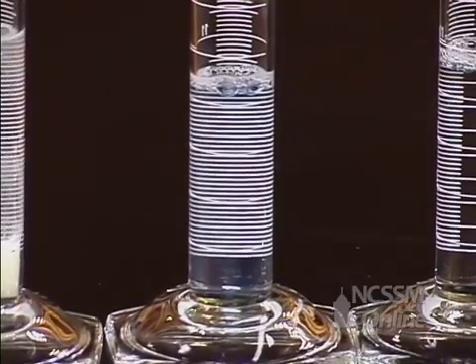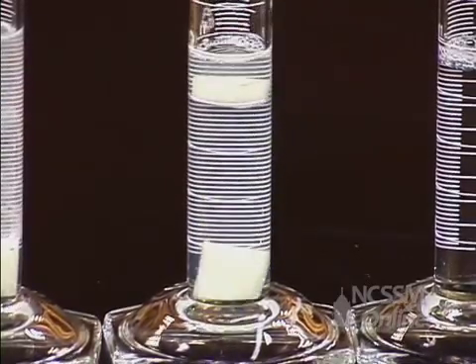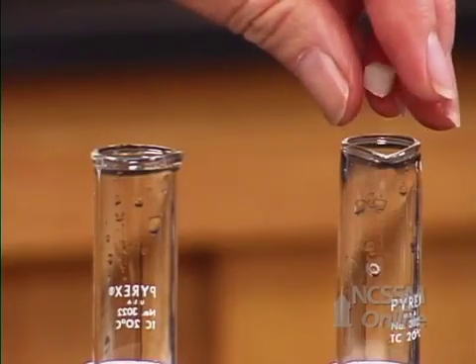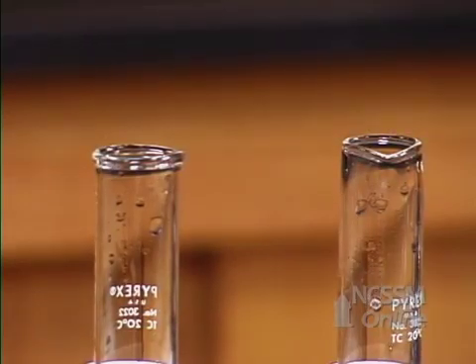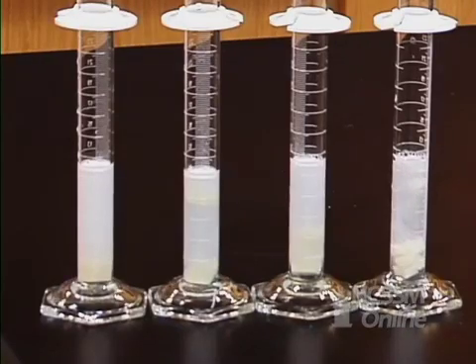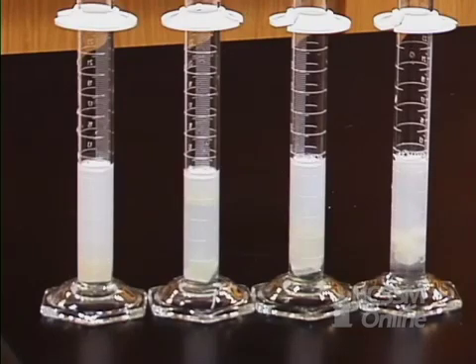Since I can't do them all at one time, I'm going to drop them in at ten second intervals. And then when we go back and collect our data, we can add ten to these consecutively.